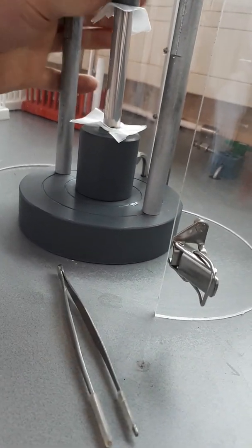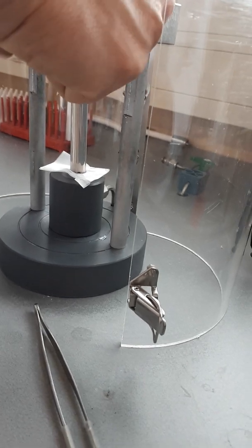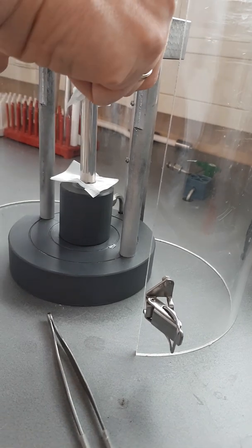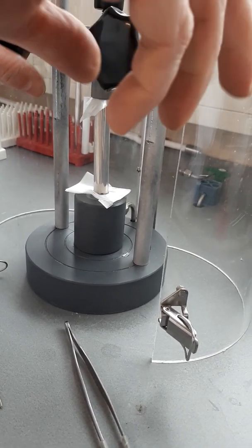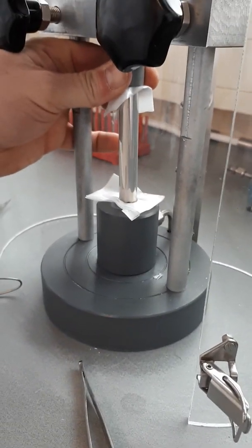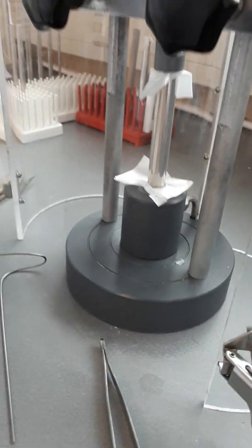You don't know what happened, Johan. Maybe due to our blessing with you here, you'll find that this one is perfect. Yeah, that should be something. But I know already, because I just looked, that the mass is way less than the other two. Yeah, because it's shorter also. No, even taking that into account.